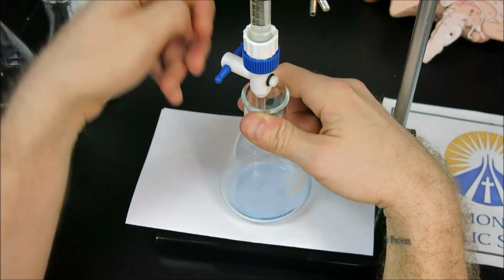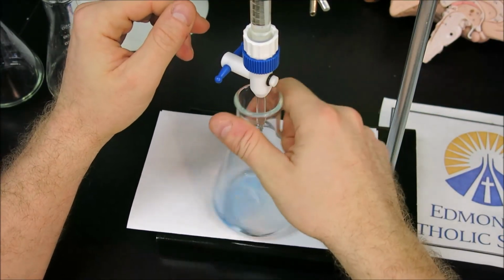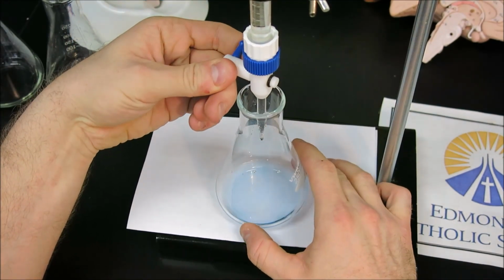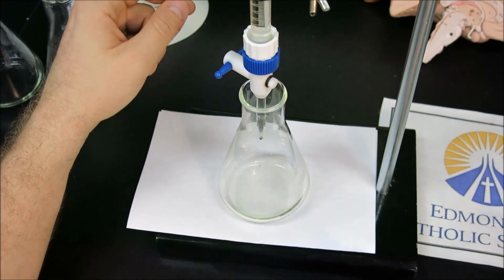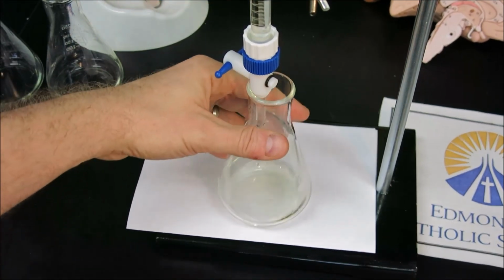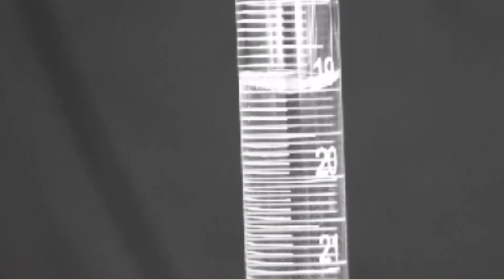As that changed almost the entire color, I will use that half a drop and rinse it in, possibly changing the color of the entire solution. Not quite. I'll attempt to do one more half a drop and see if that changes the color of the solution. And again, with only the smallest of additions, we go all the way past the green into the yellow stage, although once again not totally yellow, perhaps more of a yellowish green. And looking at this volume reading, we can see that the meniscus is sitting exactly on 19.0.